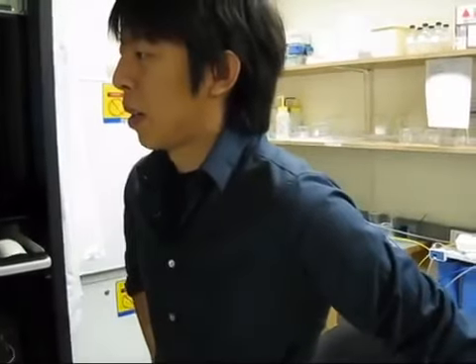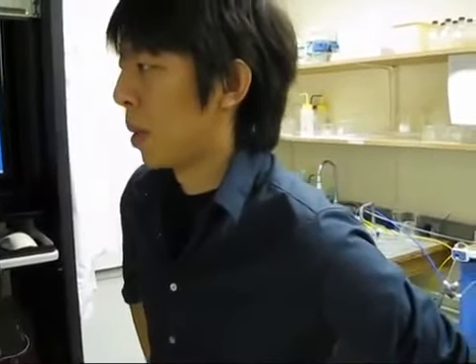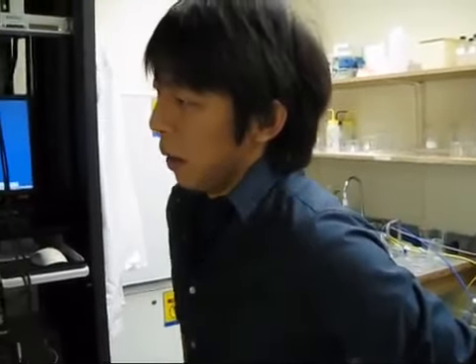And then on the other end, we're also interested in this faster calcium dynamics. So we also want to image at higher frame rates. We also have systems that scan at frame rates up to 200 frames per second, depending on how many lines we take. And this would be trying to look at single action potentials with calcium indicators. This can really only be done in vivo with multiphoton microscopy.